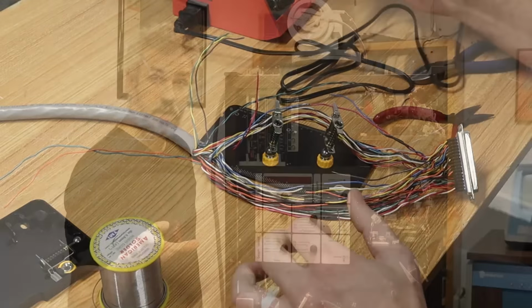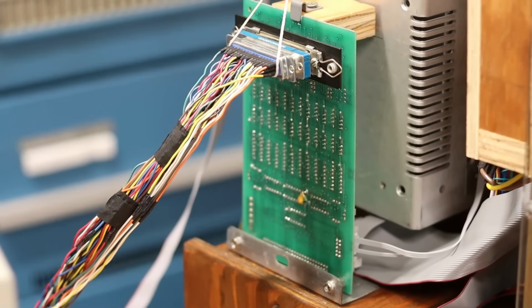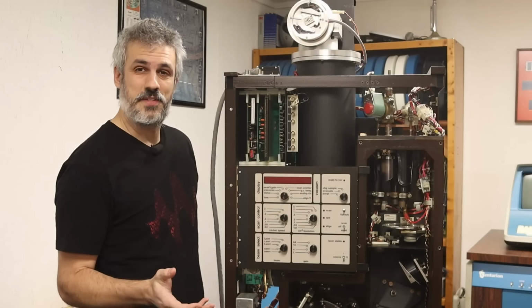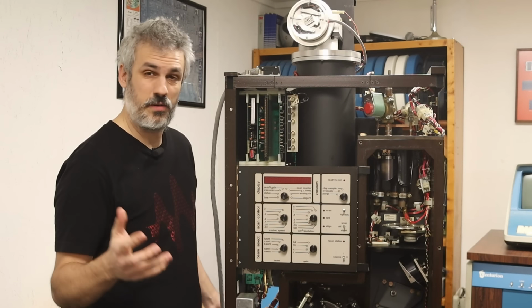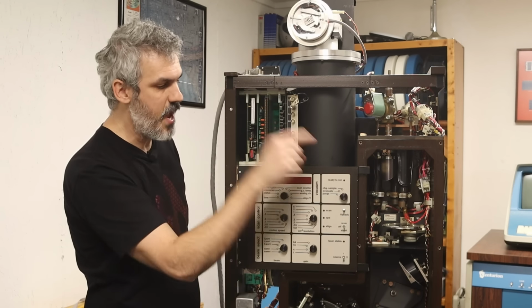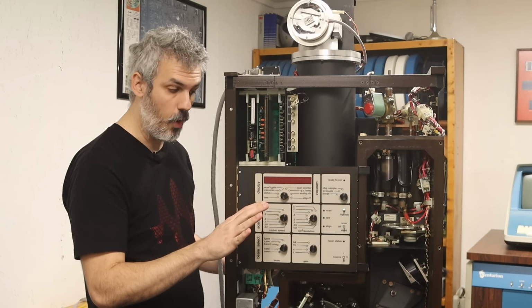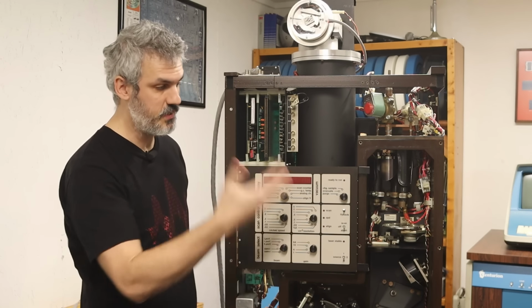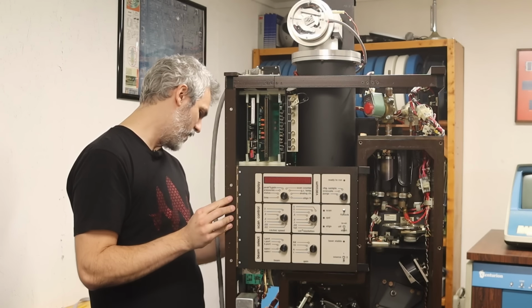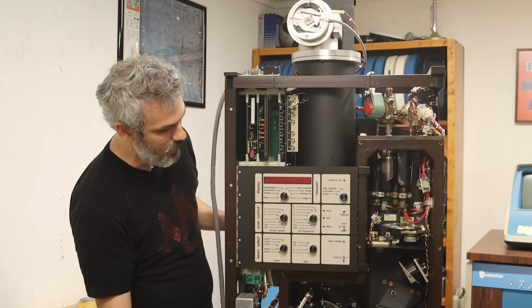All right, I think I've got that cable wired correctly now. It's a bit of a mess, and if it doesn't work, it wouldn't really be all that surprising, but I don't know, let's give it a shot. Right now, it is plugged into the Bomem and the PDP-11. The PDP-11 is not on, but it is plugged into the wall. So what we want to see is this thing come up and not do anything crazy, hopefully. All right, so I'm going to do the switch with my foot here so I can keep an eye on things. And power coming up.